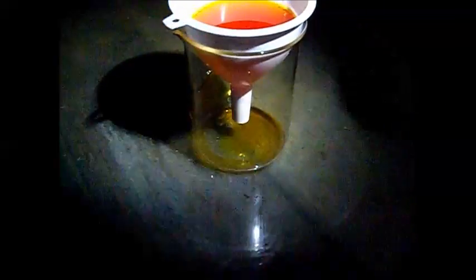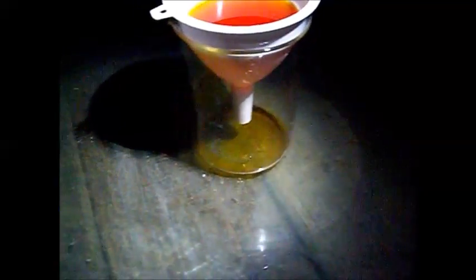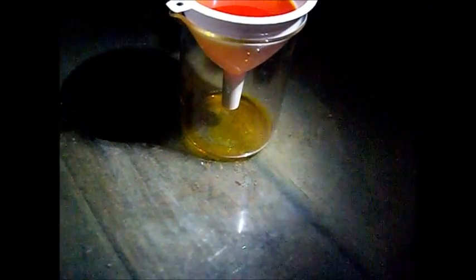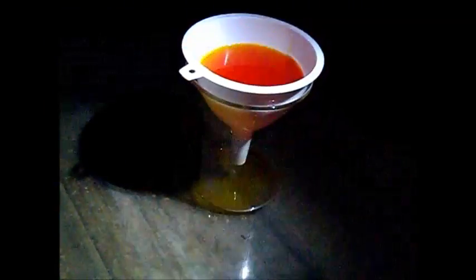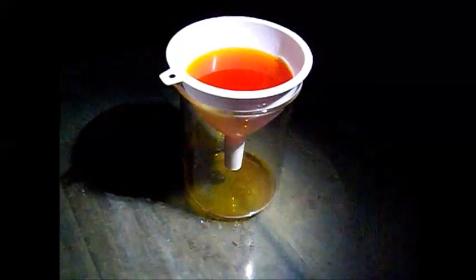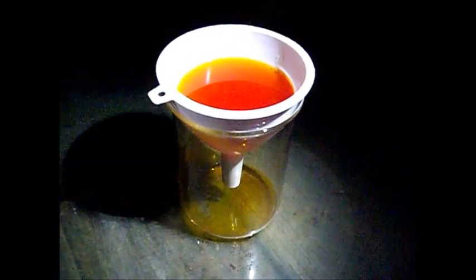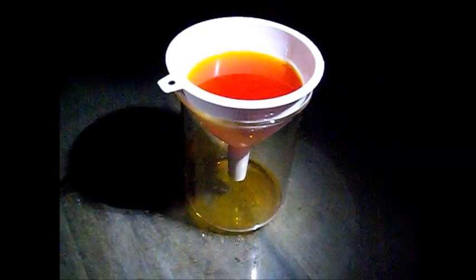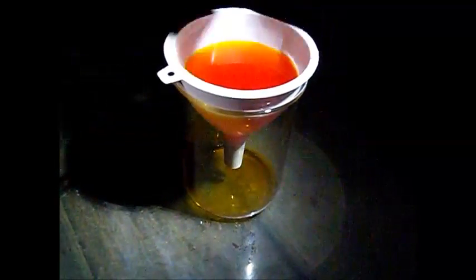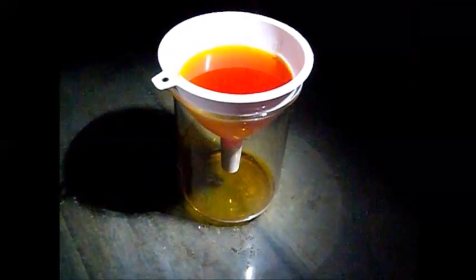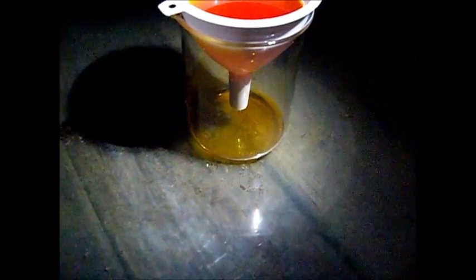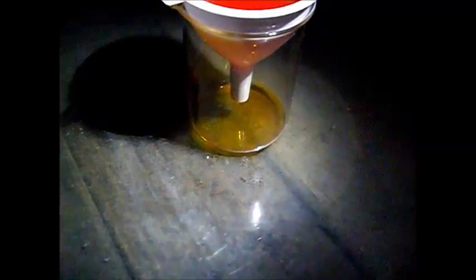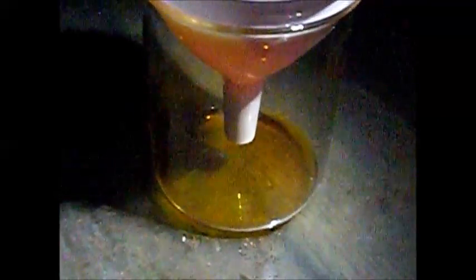This way you can get all the very fine particles out. Just pour it into the funnel, do something else, and wait for it to quit dripping. Then simply rinse out the top with a spray of water, rinse all the gold chloride down to your beaker, and you're ready to go with your drop.